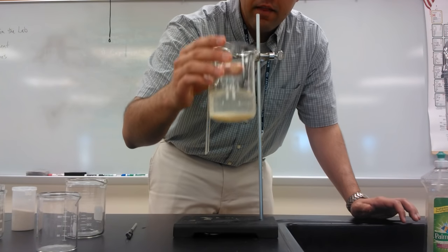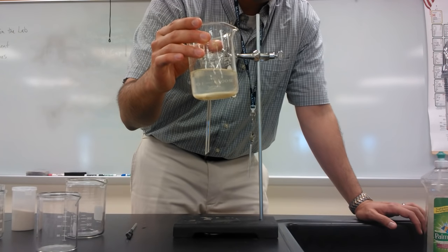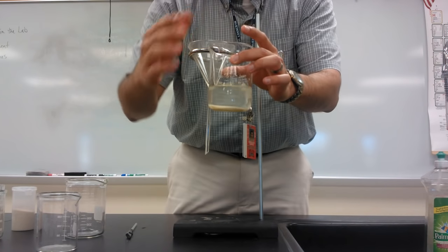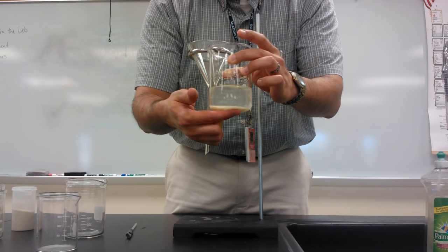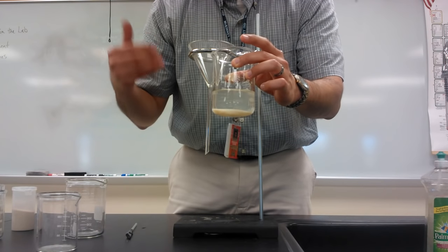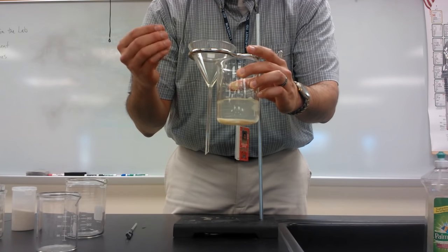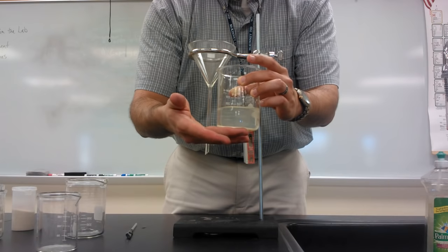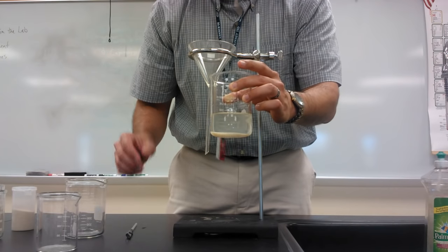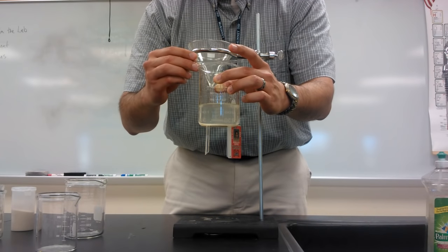So the first strategy, the first technique that we can use to separate a solid that does not dissolve in water, is we first allow it to settle down. Here we've allowed it to sit for a little while. You can see most of the sand is at the bottom of the beaker and the water is at the top. When this happens, we can decant the liquid. So we're going to decant the liquid on top. Decant means to pour out carefully so that you leave the sediments on the bottom. The sand that is on the bottom — I want to keep it there — and I'm going to pour carefully into another container in order to begin separating them. And this is going to be a rough separation.